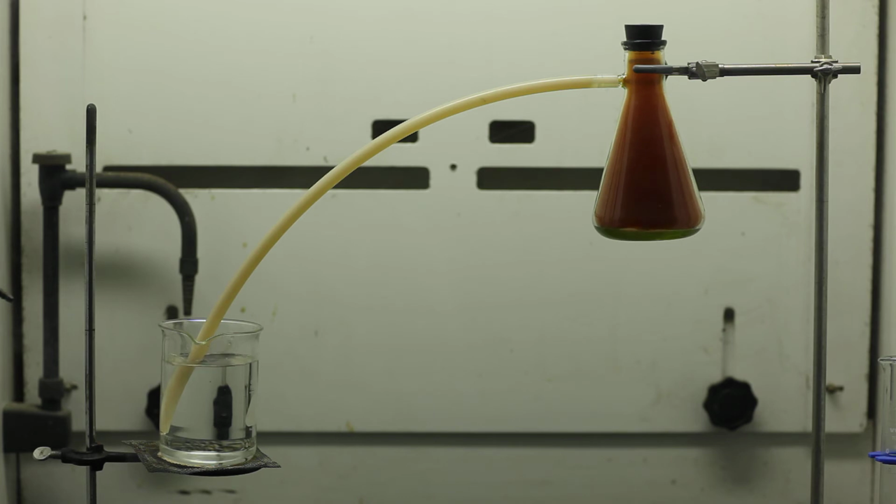"But what was this wonderful thing which I beheld? The cent was already changed, and it was no small change either. A greenish-blue liquid foamed and fumed over the cent and over the table. The air in the neighborhood of the performance became colored dark red. A great colored cloud arose. This was disagreeable and suffocating. How should I stop this?